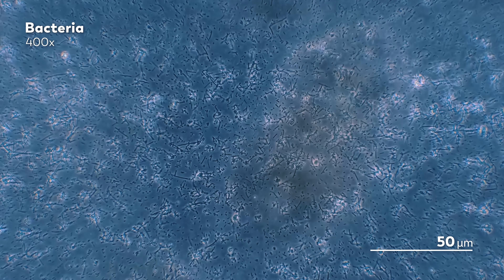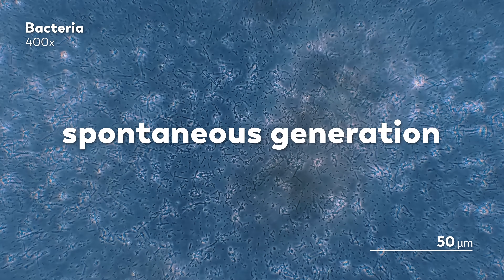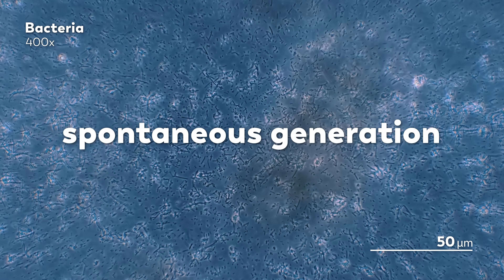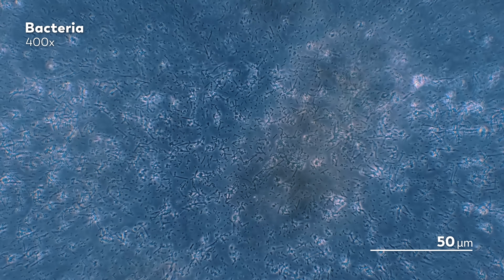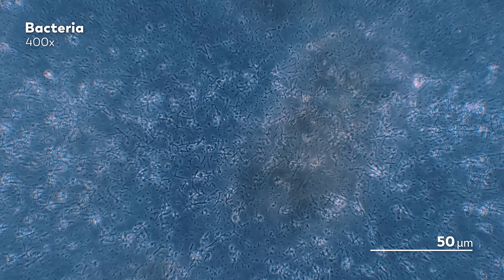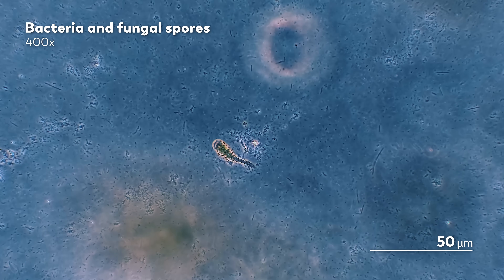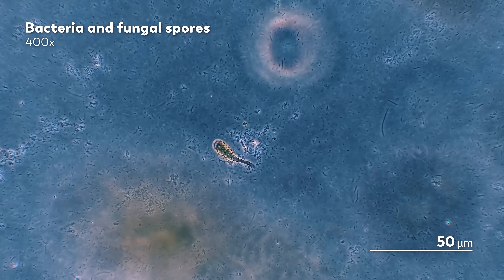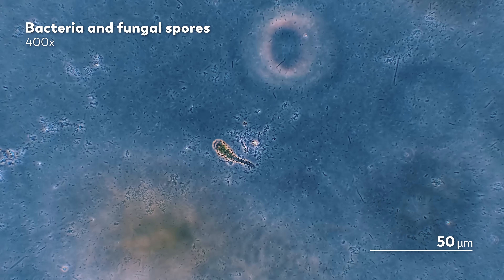The concept Pasteur wanted to discuss was called Spontaneous Generation, which posited that perhaps living things could just appear from some other kind of matter, though there were various ideas about how exactly that could work. It was an old theory, and it took several centuries worth of experiments to prove that it was wrong. A year and a half ago, our Master of Microscopes, James, was inspired by the idea of Spontaneous Generation and set up his own experiment.